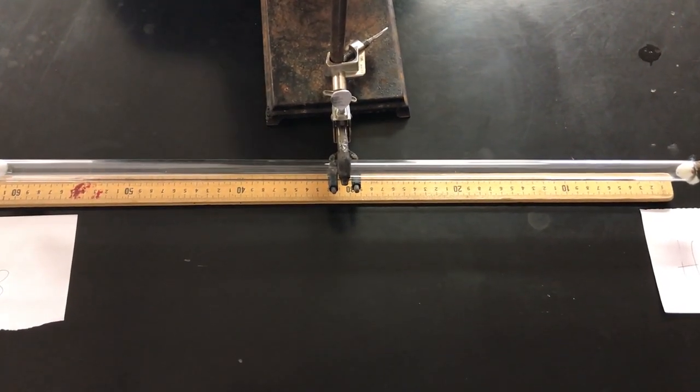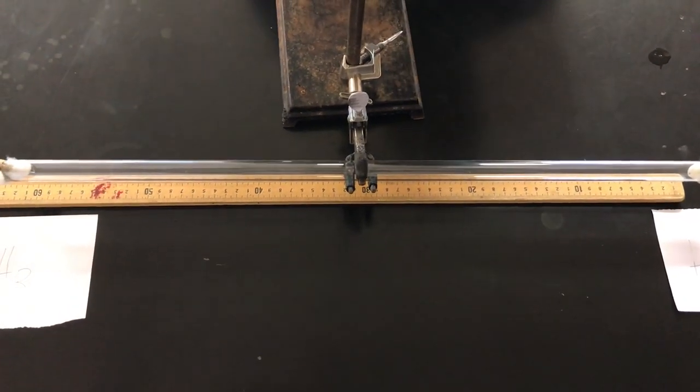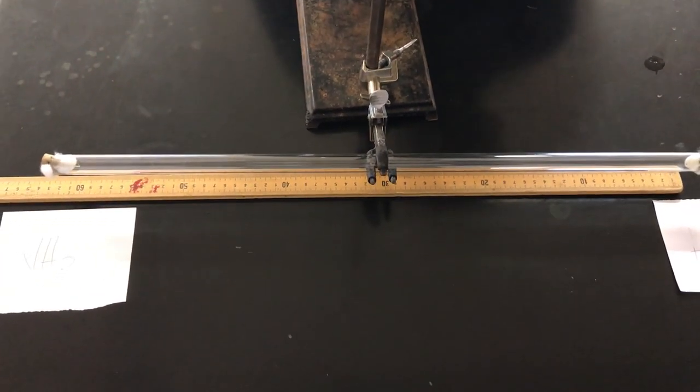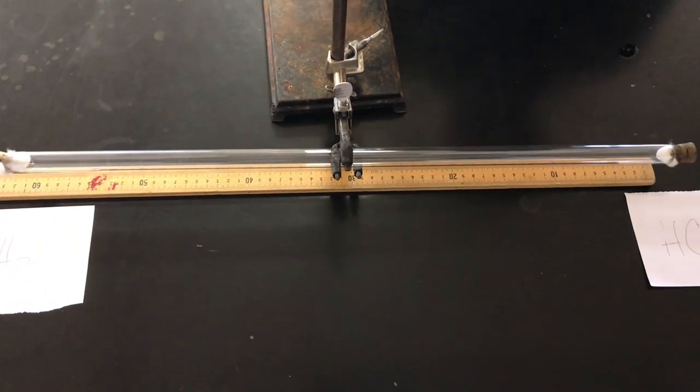The heavier a gas is, the slower its particles move. So now we're patiently waiting until we can see the smoke ring form.